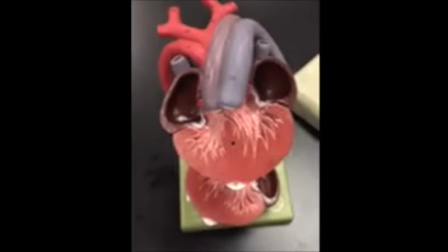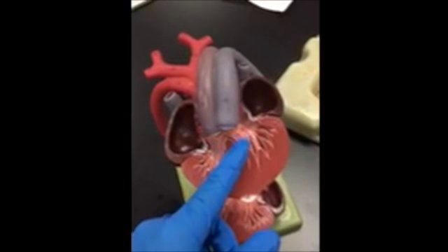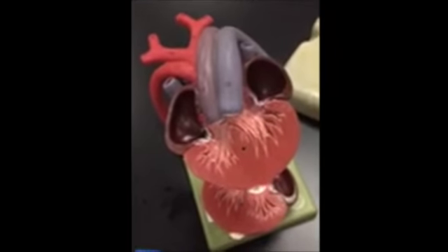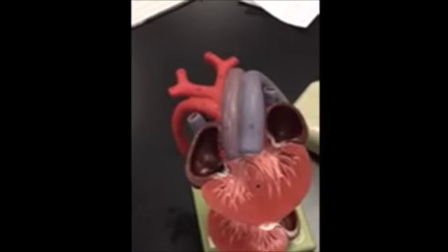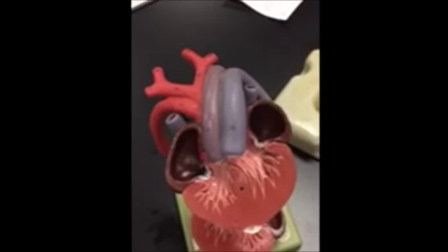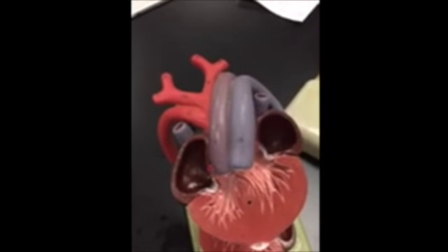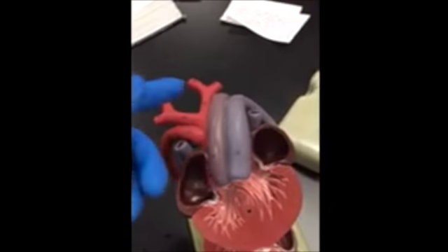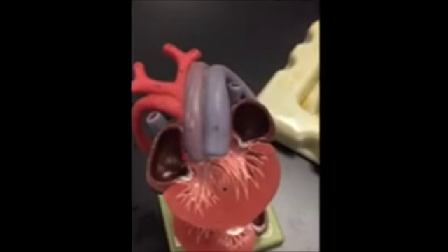Here's the heart of the snake. It's a three-chambered heart. Here's the right atrium, the left atrium, and here's the shared ventricle. This is a pulmonary artery, which pumps the deoxygenated blood into the lungs. And here's the other artery, which pumps it to the rest of the body. The snake has a double circulatory system, which means that it has the systemic circuit, which pumps the blood to the body, this is the job of the artery, and the pulmonary circuit, which pumps the blood to the lungs.